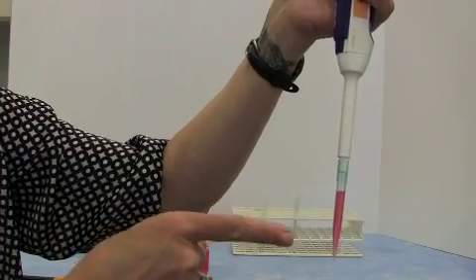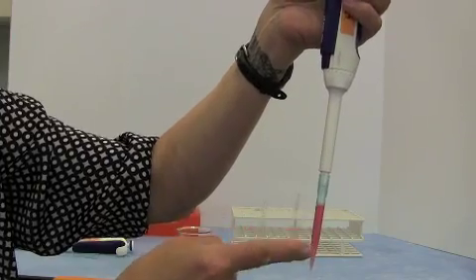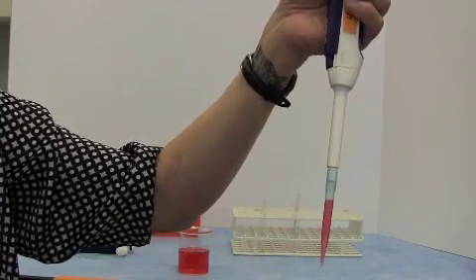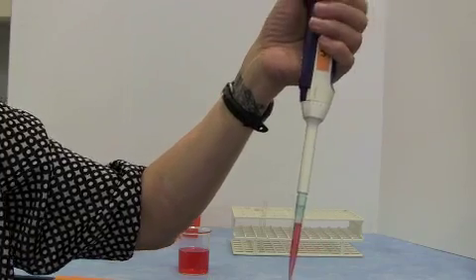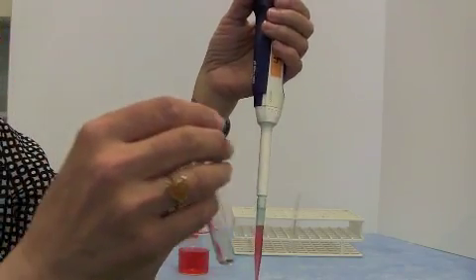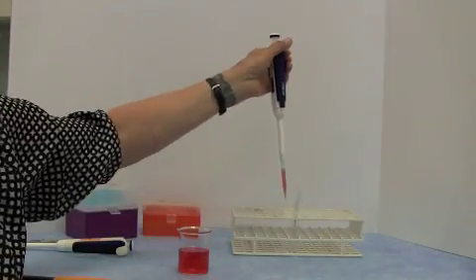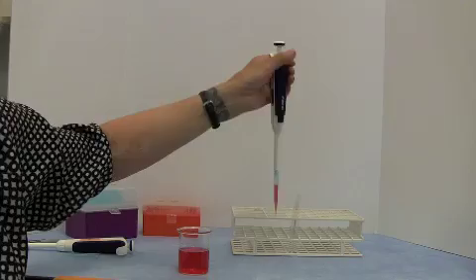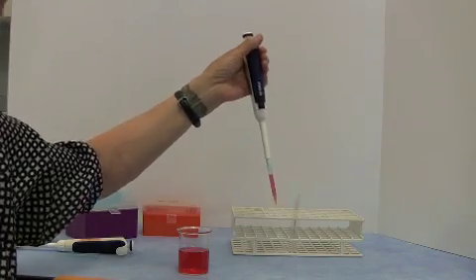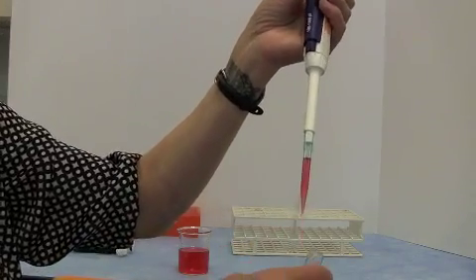You then look at it. You say, okay, does that look like 1 milliliter to me? And make sure that there are no air bubbles in the volume that you just put into the tip. Then you pick up the thing you're going to pipette into. And this is really important. You don't want to just have things on the bench and be stabbing at them with the pipette, because you can knock things over really easily. So you always want to have one hand on the thing you're pipetting into.